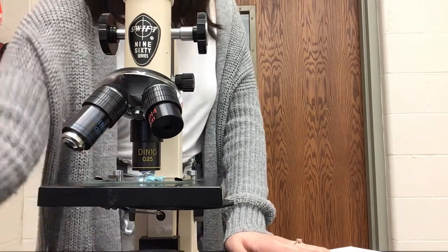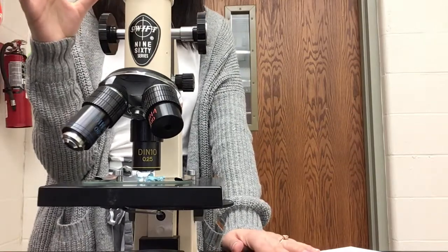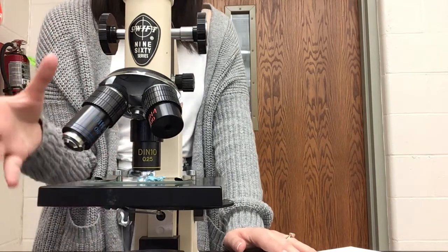Okay? All right, so I'm going to post the photos, and what I want you to do is, how did the molecular compound look different from my ionic under the microscope? So I will look that up.